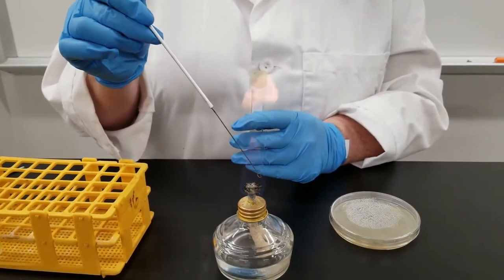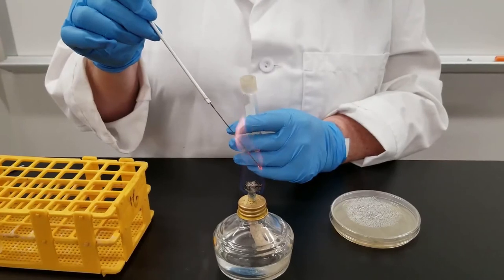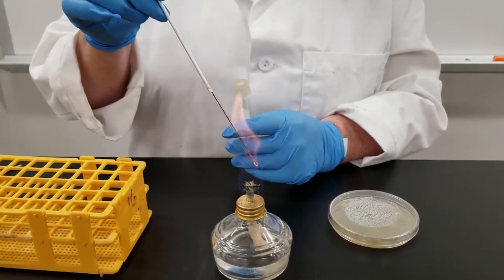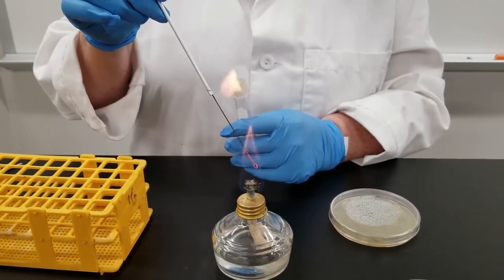So the test tube, you notice that I flamed it before and after opening it. Once again, trying to reduce any potential contamination that could occur. You flame your loop between every process.